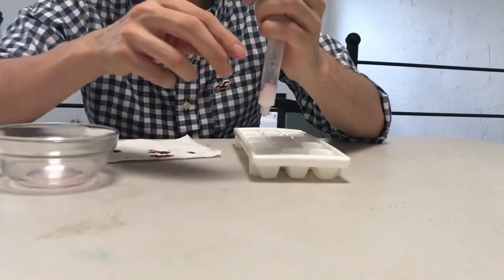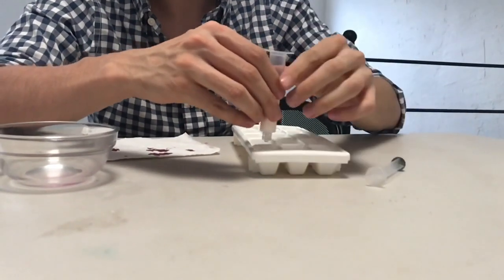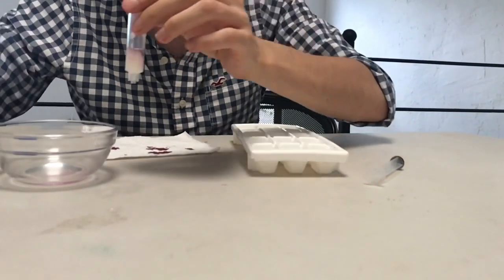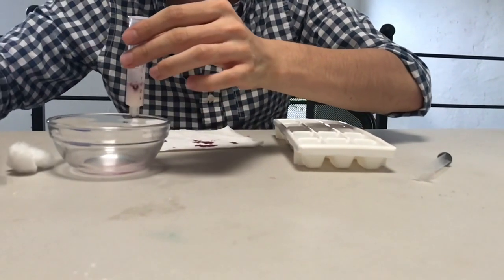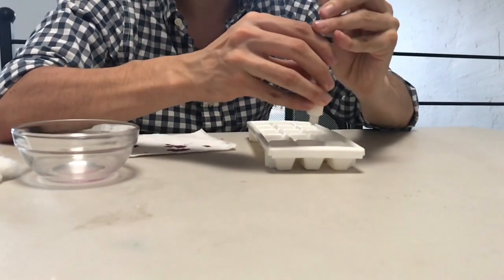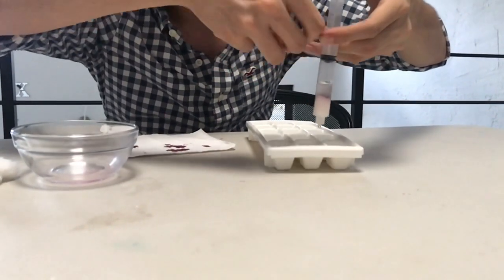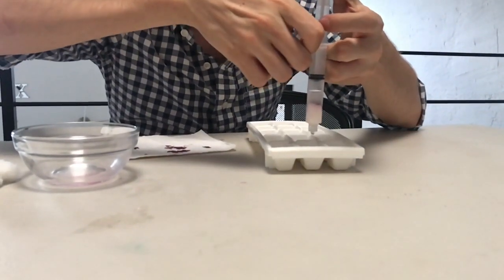Remember, always add mobile phase. It must not dry, so take a lot of care with that. And I'm doing it faster, but you can pause the video and see step by step while I'm doing it. So we do this, and all the drops go to one palette.